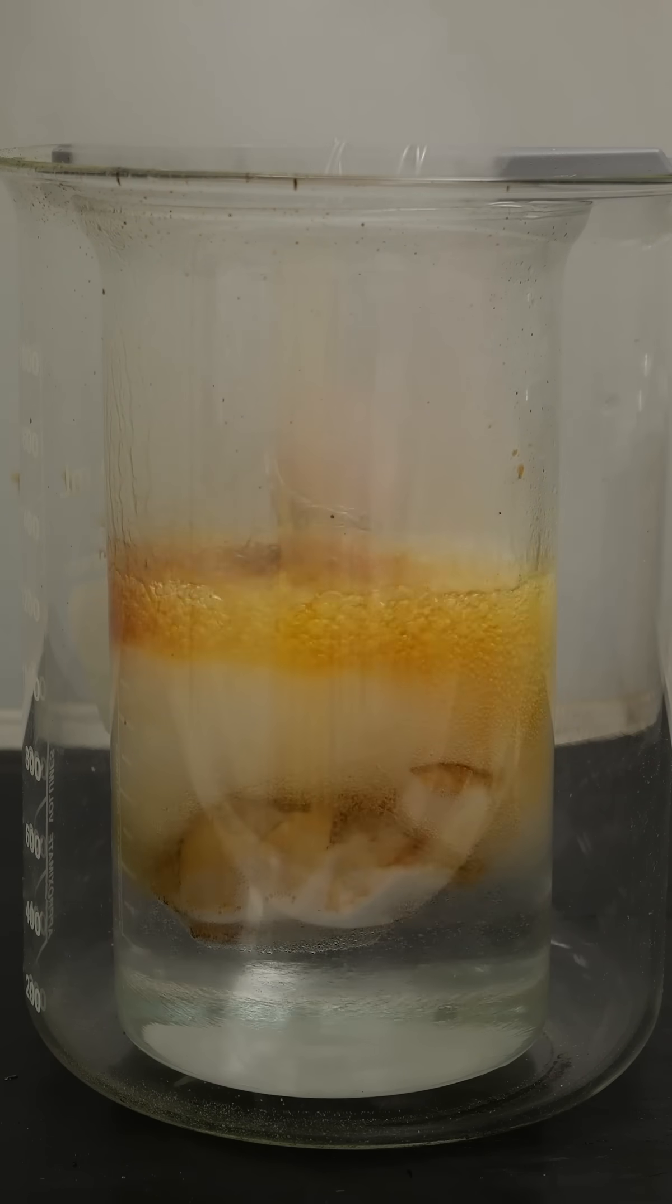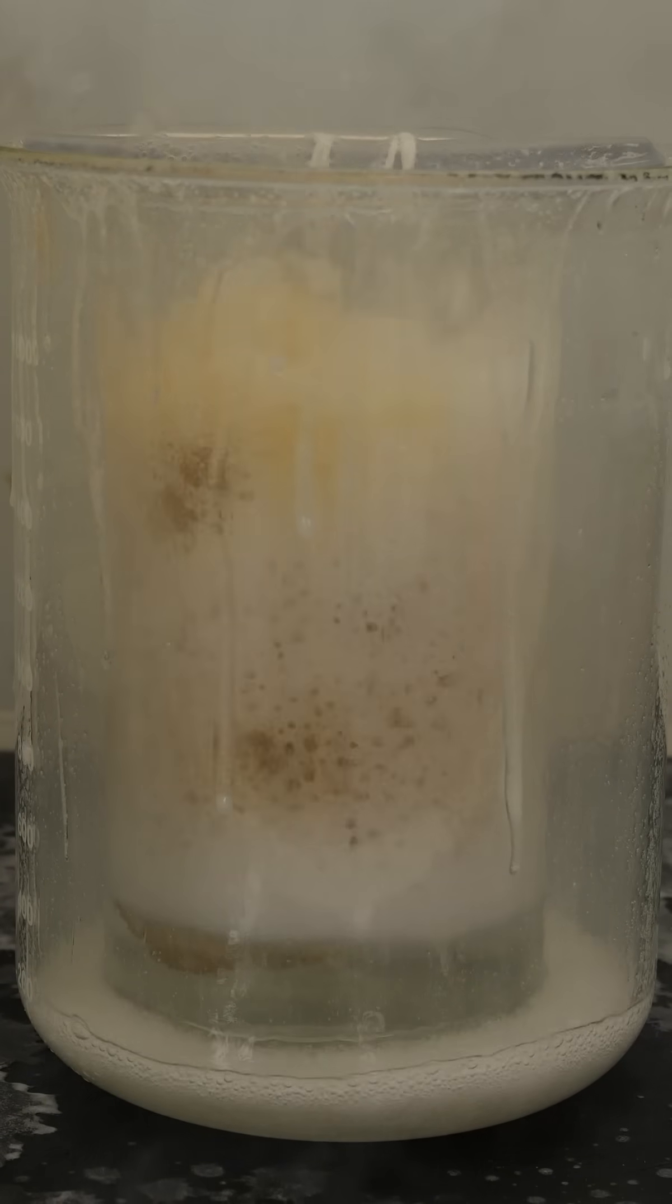That's piranha acid, the most aggressive acid I know. It barely leaves anything of the chicken behind at all.